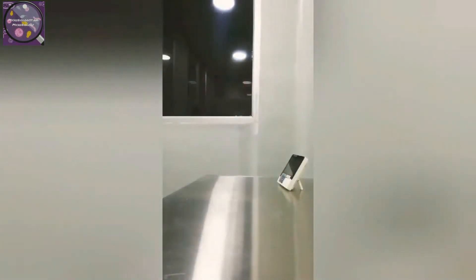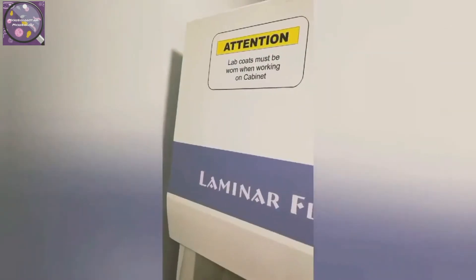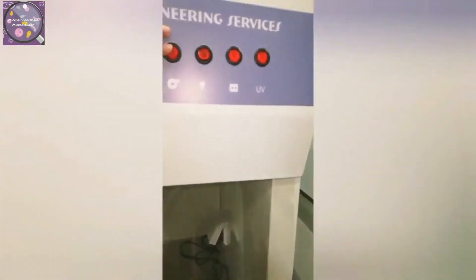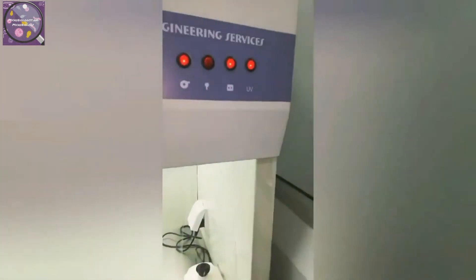Laminar airflow cabinets may have a UVC germicidal lamp to sterilize the interior and contents before usage, to prevent contamination of the experiment. The light must be switched off when the cabinet is being used, to limit exposure to skin and eyes, as stray ultraviolet light emissions can cause cancer and cataracts.